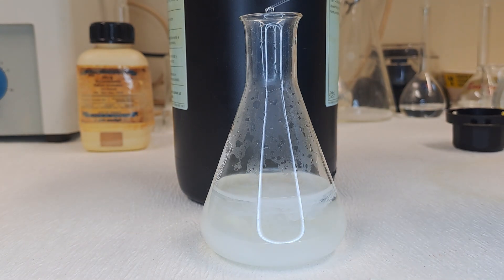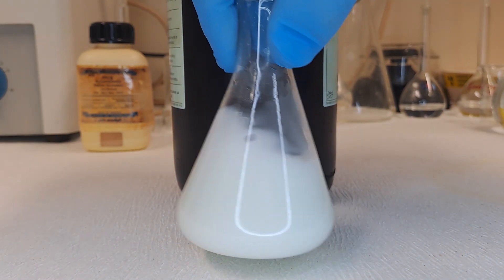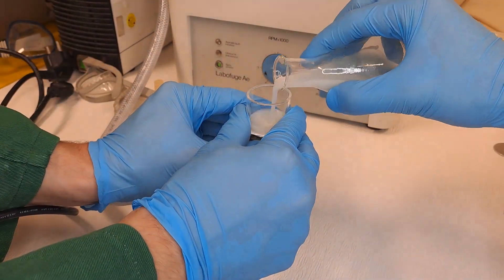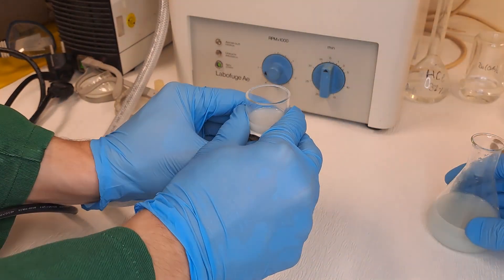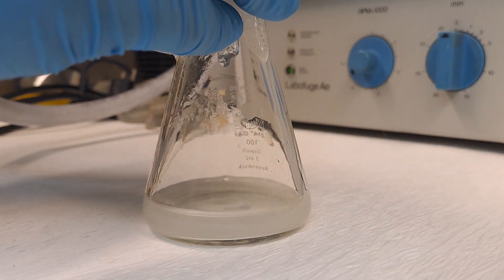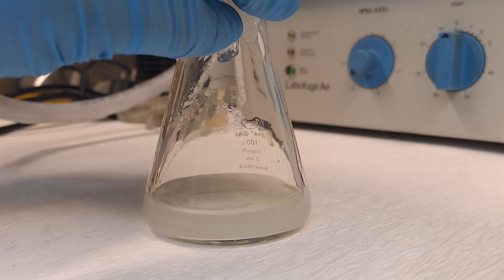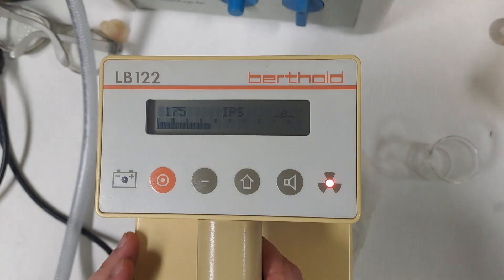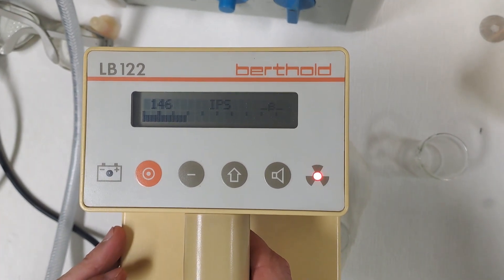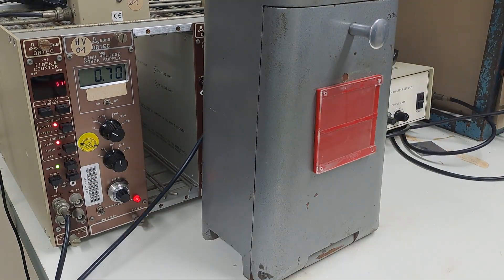It takes quite a bit of silver nitrate solution because we really want to precipitate all the bromide — and the thought of it being partially radioactive silver bromide makes it even cooler. This suspension is then filtered, leaving the filter paper with the silver bromide. Optionally, the solid can be scraped together for better measuring results. The whole thing is placed on the Geiger counter and measured for one minute, followed by a five-minute wait — rinse and repeat for a total of 15 cycles at six minutes each.